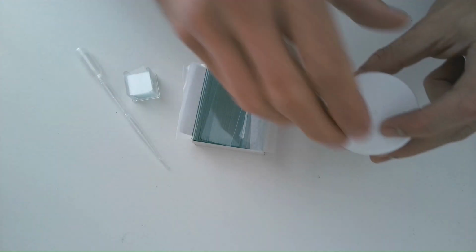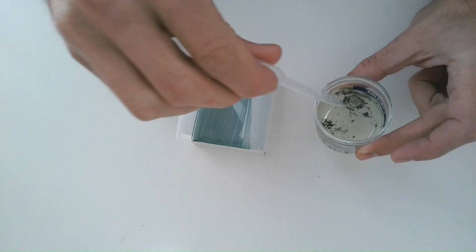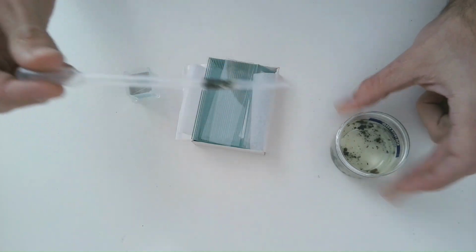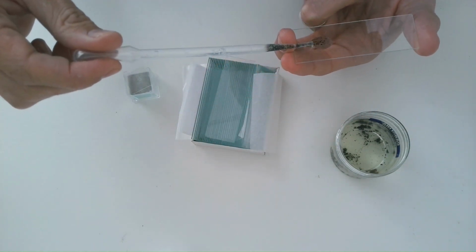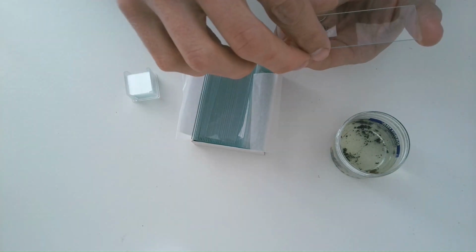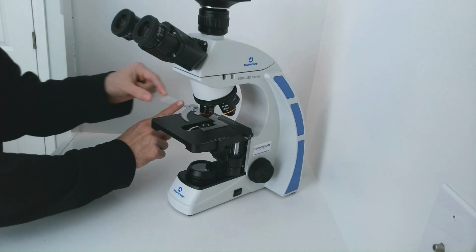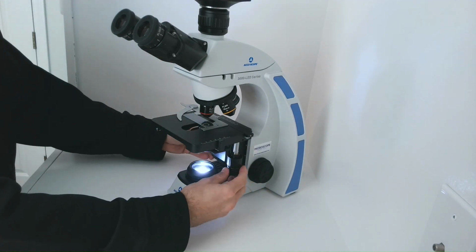Welcome to the exciting world of cell biology. Here's a lab sample containing mostly protists, which are single-celled eukaryotic organisms. And what's really cool about them is they are relatively easy to view under a microscope. All we have to do is take our water sample, put a couple drops on a microscope slide, then apply a cover slip, and then we go searching for tiny organisms under our microscope.